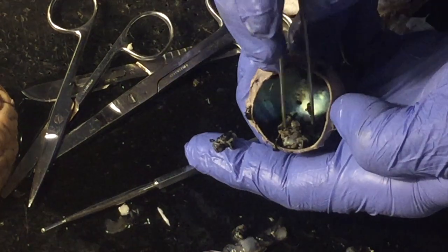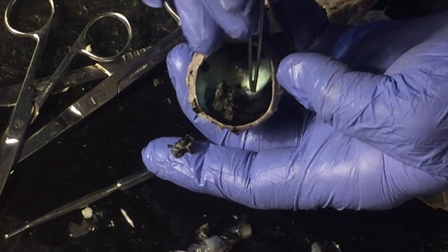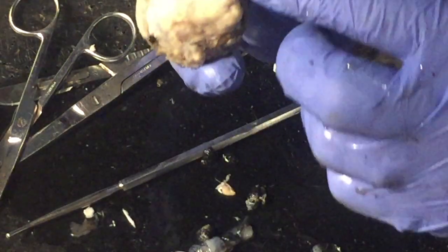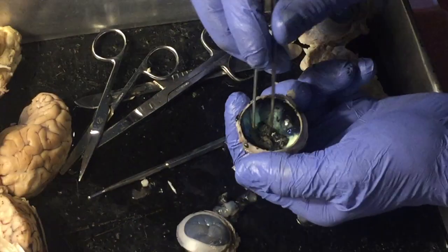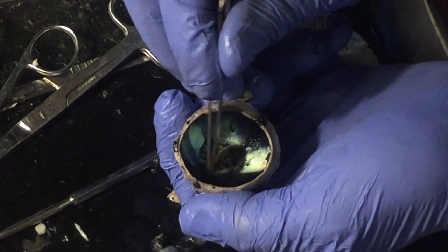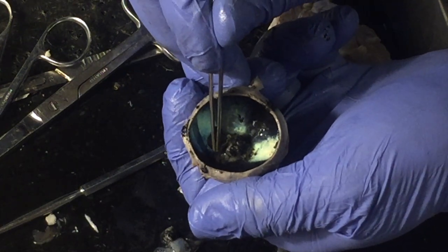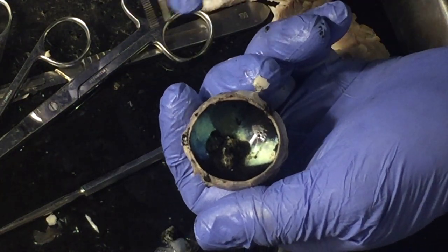But right here, where it's attached, this is the retina. That's where the optic nerve would leave. And if we flip this over, that's also exactly where the optic nerve exits the back of the eyeball. When you focus an image on the part of the retina right here where it forms the optic nerve, there are no rods and cones there. That is your blind spot. So in the lab manual, when it asks you to look at the dot and the X, you are attempting to focus that image on this part of the eye.